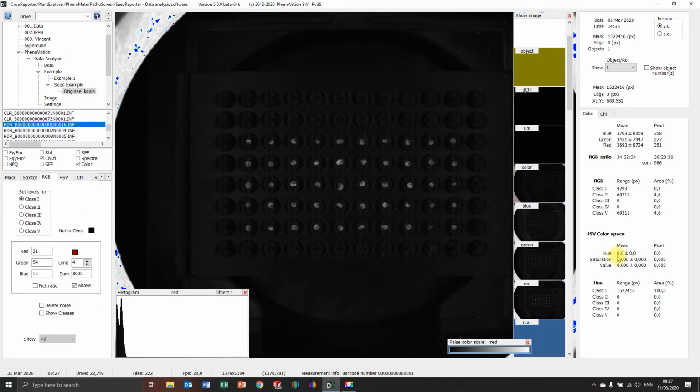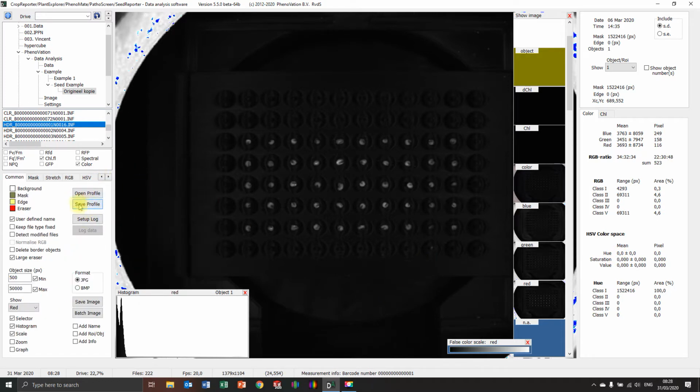So to start off, I've opened the data of the seeds, and I also received the settings that my clients were using. So they had certain settings. You can save them here. You can say save profile, and then I can open that profile to see which settings you have put in to get the data out of the images.